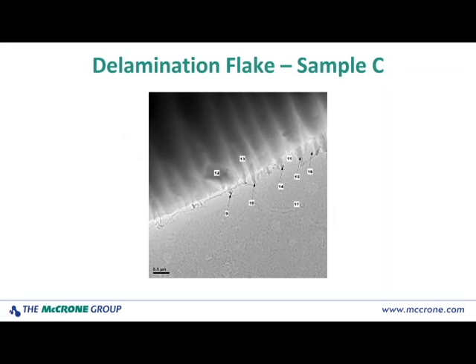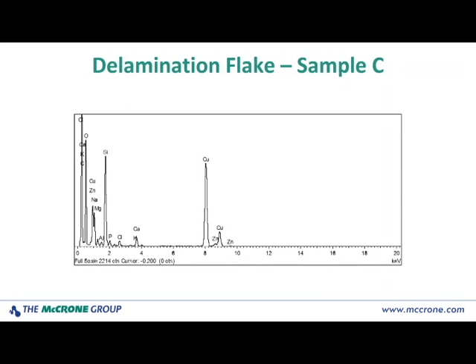And you can see that along this area where there's some alternation of contrast, and this is probably just differences in thickness and fracturing of the glass, but all of the numbered areas indicate places where I was able to get EDS spectra, just to see if the differences in contrast or very small dark contrast features might reflect a difference in elemental composition. But in this case, everything looked very uniform and again looked very typical of a glass material.